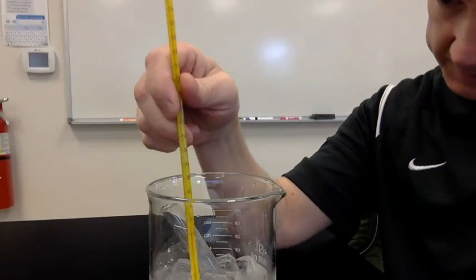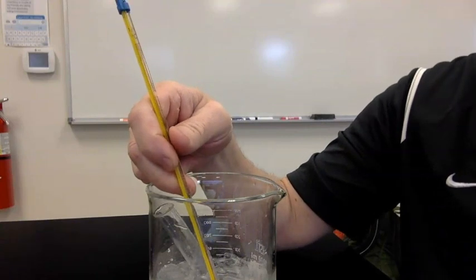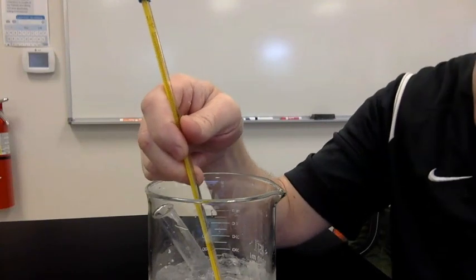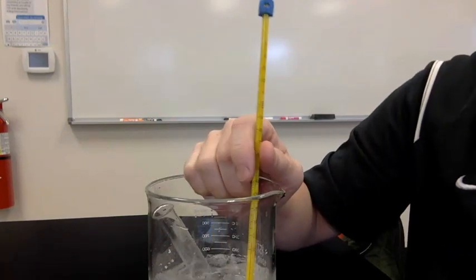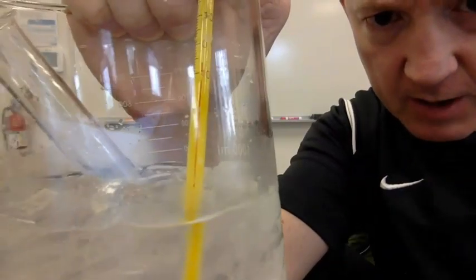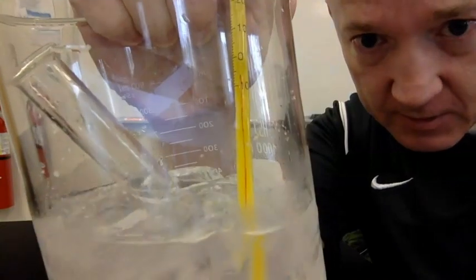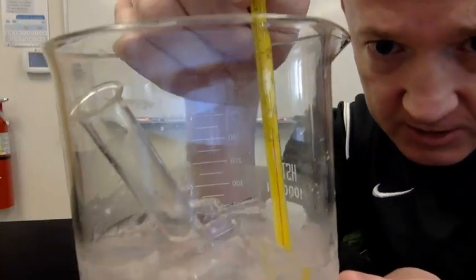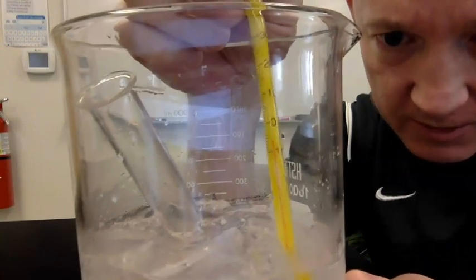Well, this is crazy. I'm sitting here and I might be watching the laws of physics being broken. I have water here. As you can see by the thermometer, there's the zero mark. The zero mark, you see it? This is about 6 to 7 degrees, 6 degrees below 0 Celsius.